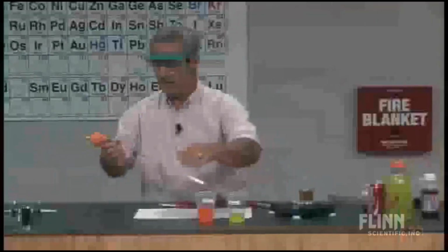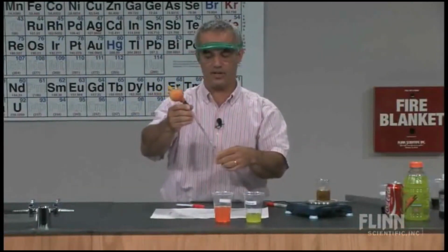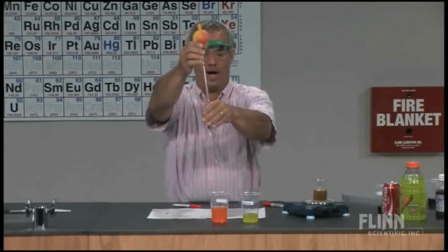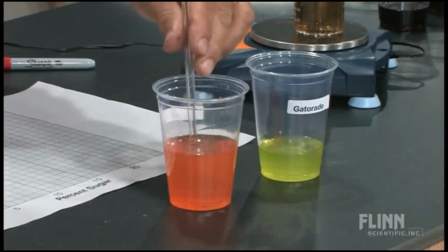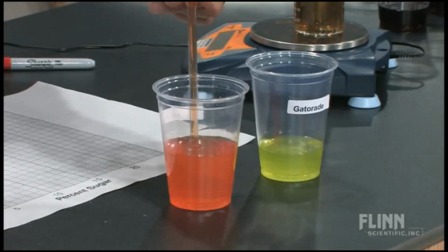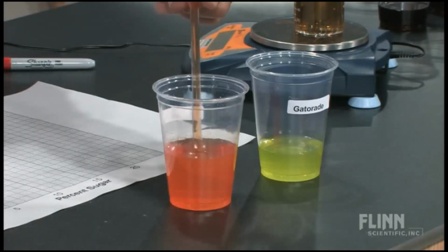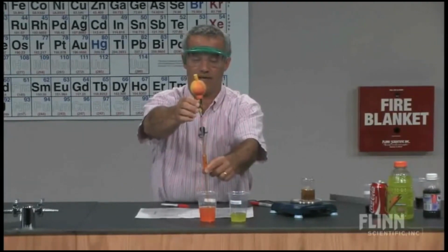Orange soda. By the way, this was poured back and forth in cups to get rid of the carbonation. I think you can think about why that's the case. If I did this with a freshly opened bottle of soda, I'd be having all kinds of bubbles in here, and that would obviously throw off the reading. Actually, as it is, I got little bubbles off the bottom there, but that would throw off the reading. I'd have a bunch of air mix in. Which direction would it throw it off? That's a good thing to consider.